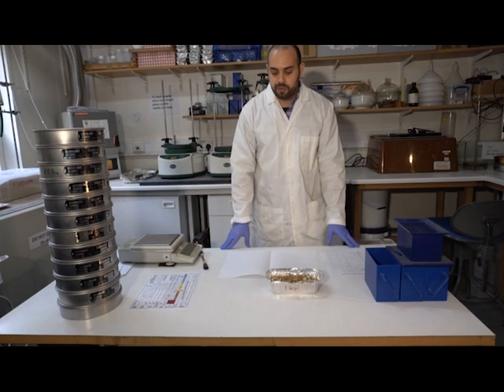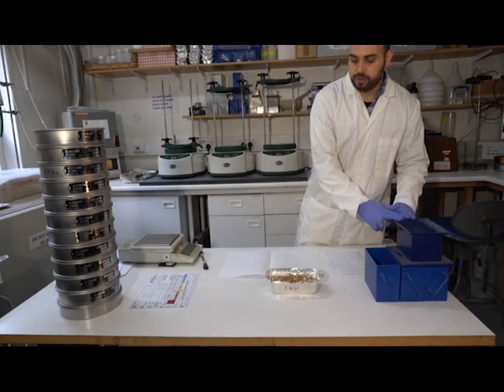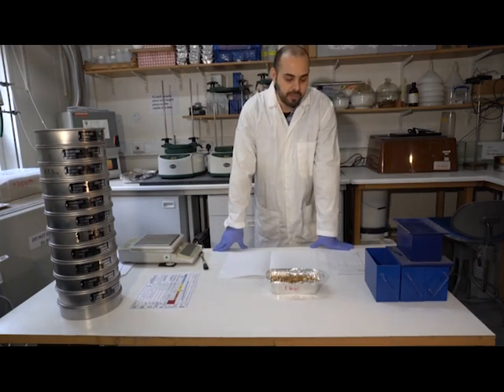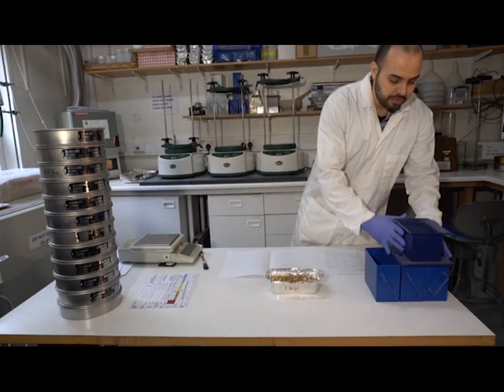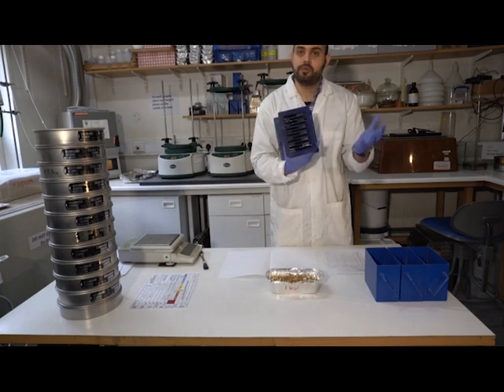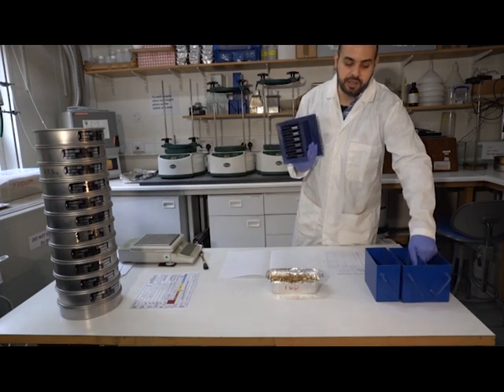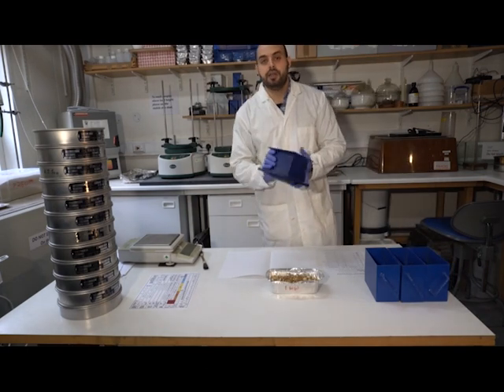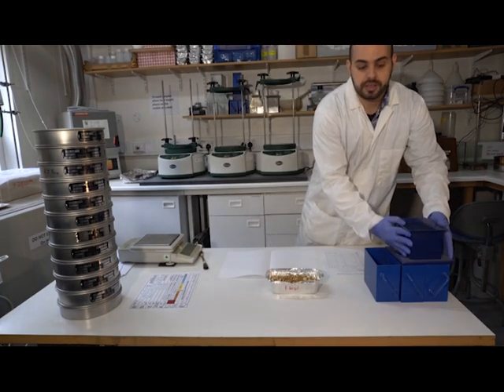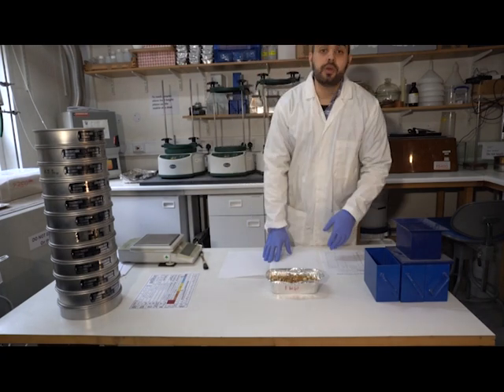And because we want to do replicates, we want to subsample our sediment, and so I've got here a riffle box. So to subsample our sediment, we can do two things. We can either use a riffle box, which is essentially this construction here that allows us to randomly select sediment and split our sample into two boxes. So we can analyze one, then analyze the other one, and therefore have a replicate of our sample to be more robust statistically. If you don't have a riffle box like this, you can do quartering.